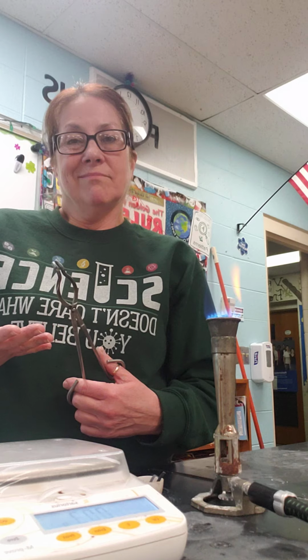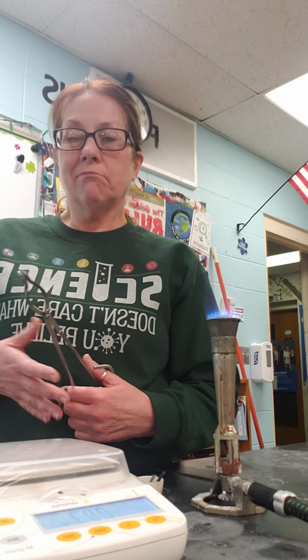Hi guys, today we're going to do that lab in your textbook on page 232, evaluating systems in chemical reactions. This is a way we're going to have to do labs for a while. Oh well, we'll make it work.